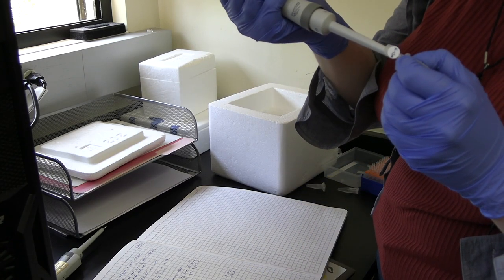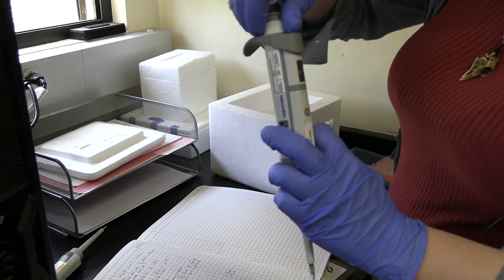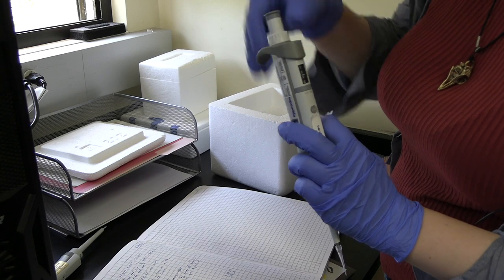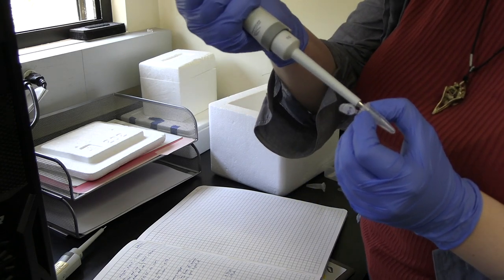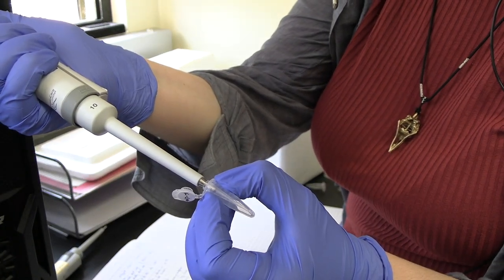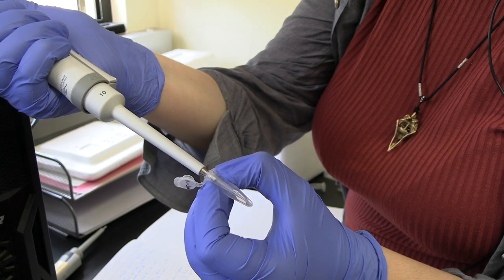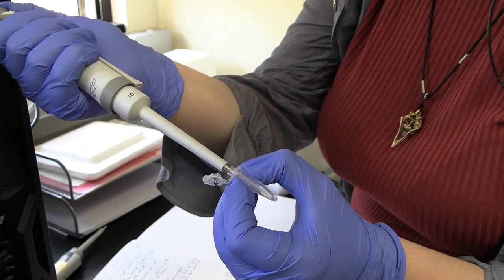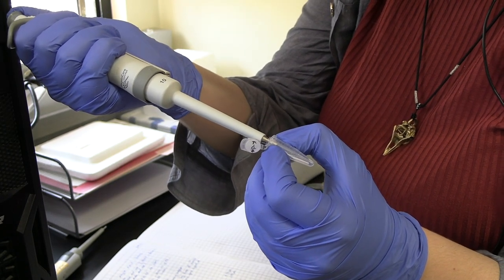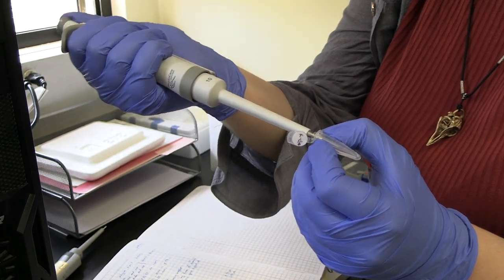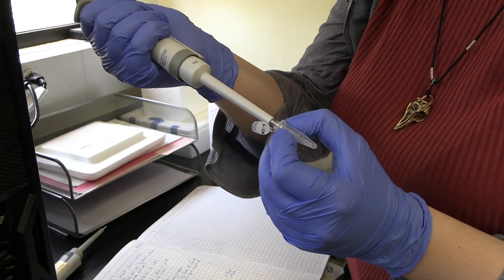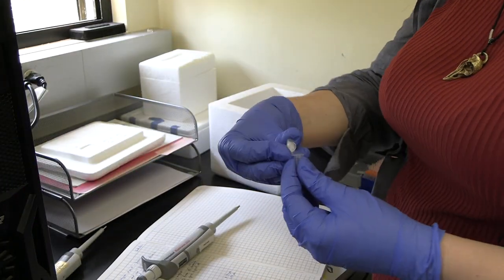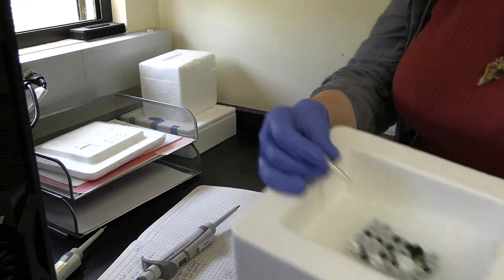That's pretty much all the reagents you need to add. Now I'm going to dial up my pipette to the max, about 10. This whole solution is about 10 microliters, so mixing at 10 should be good. Gently draw from the bottom and pour down the sides. Try to get minimal bubbles. Just mix it up until you don't see any inhomogeneities. You want everything nicely combined so we can incubate this on ice for at least 30 minutes before we add it to a sample. Then all our motors will be formed into clusters.